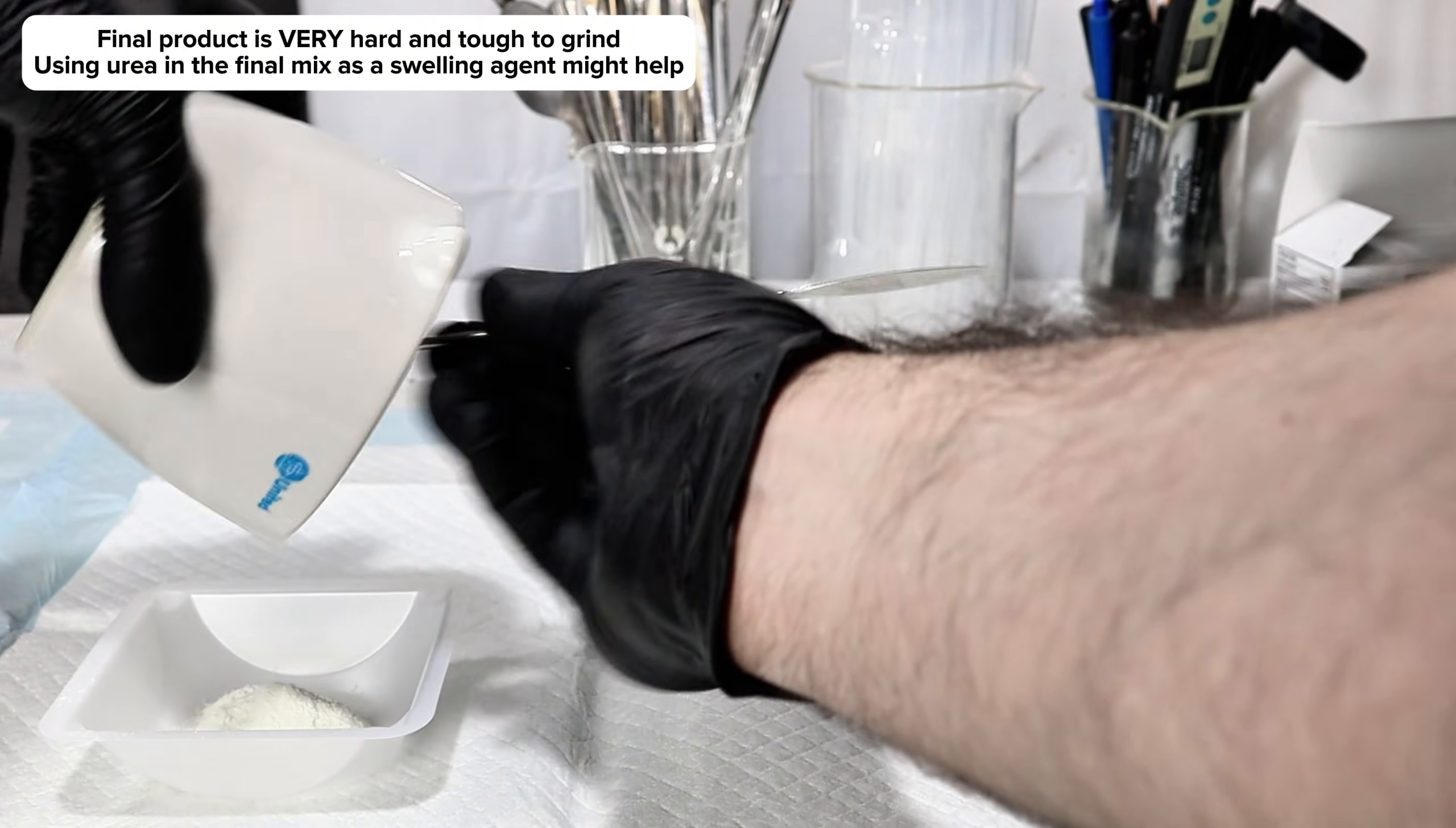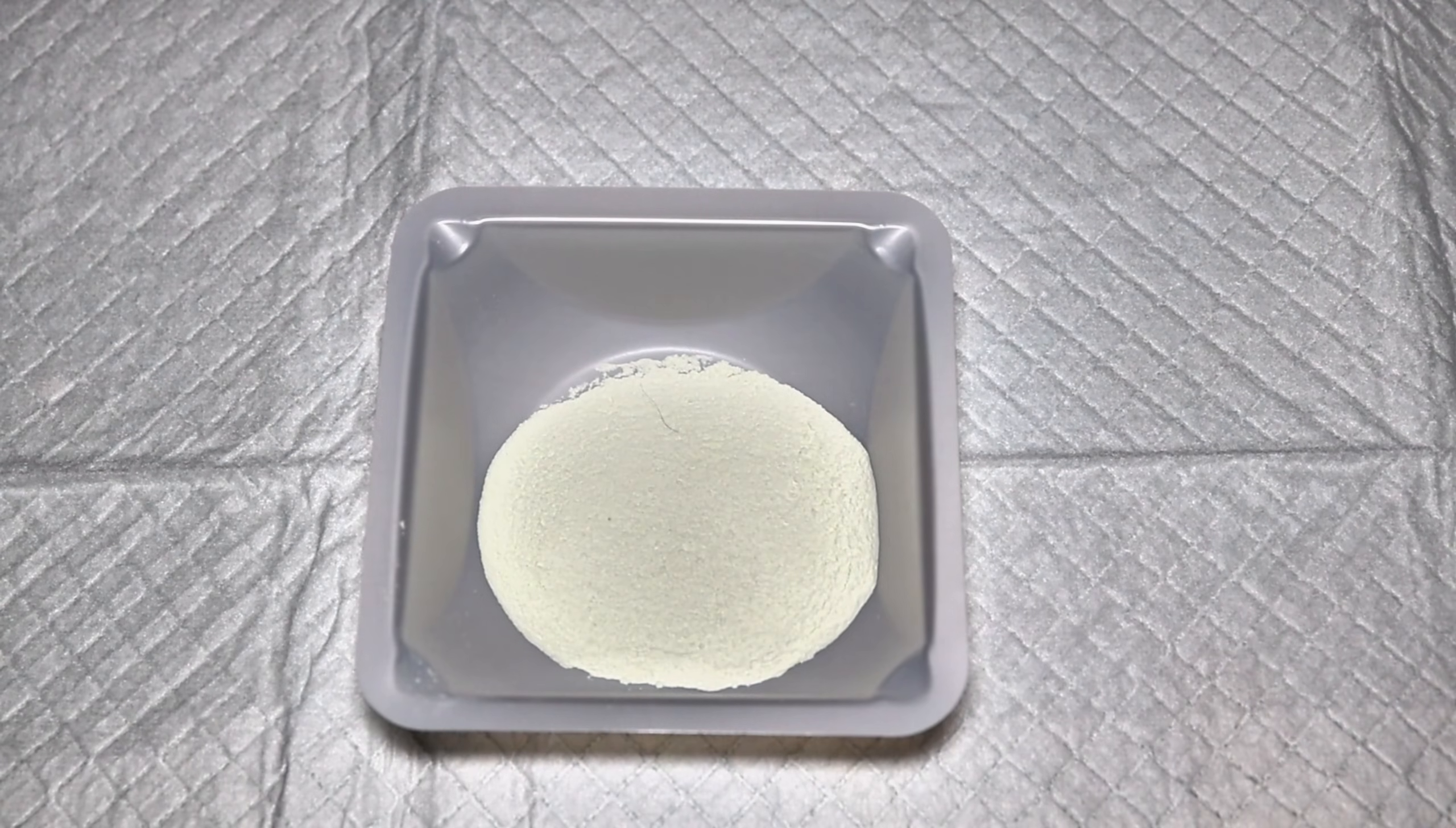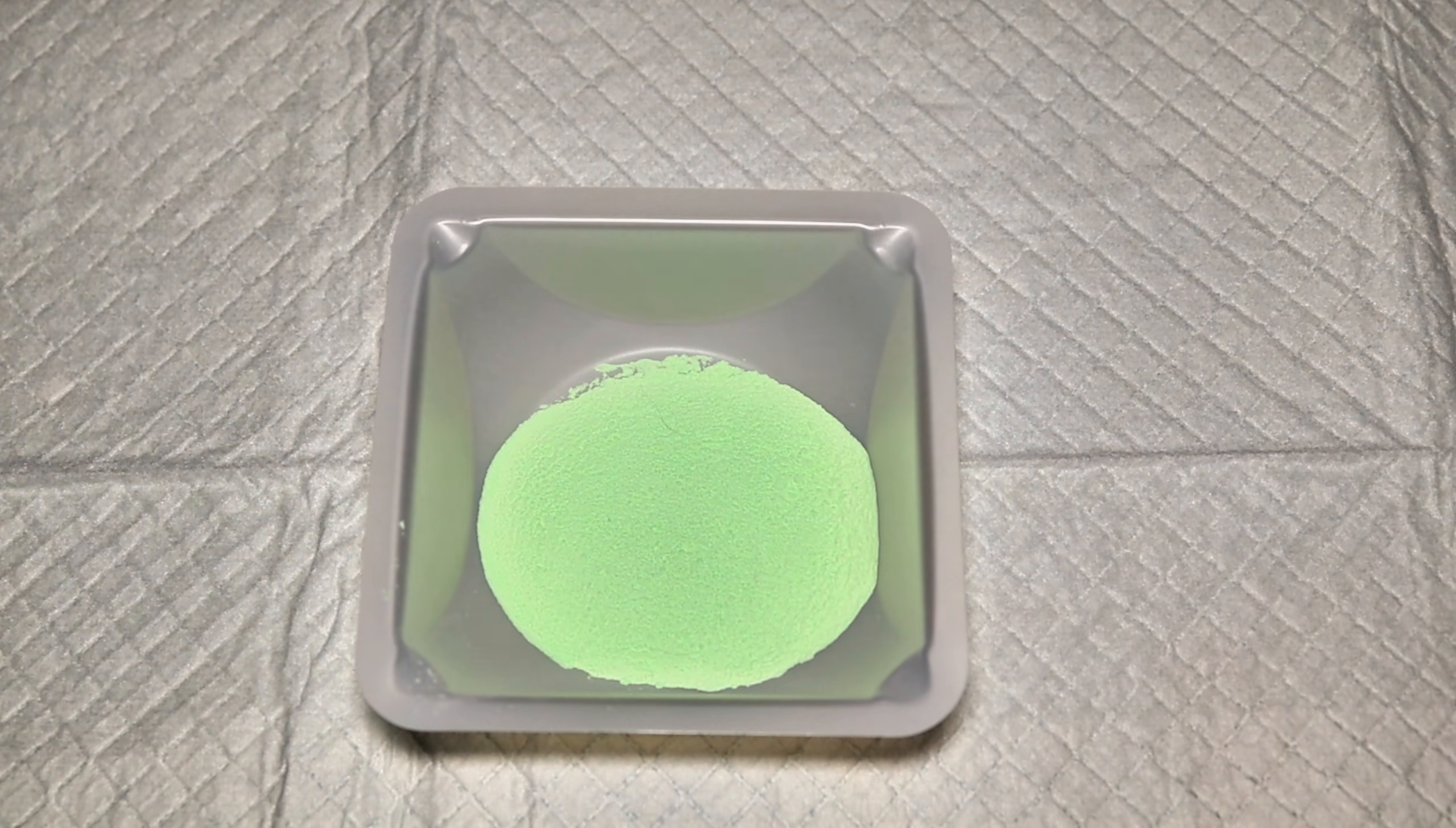Eventually, I did finally powder it down to the point that I felt it was as good as it was going to get, and then I dumped the resulting powder into a weighboat. I went ahead and then cut the lights and was delighted to see my powder glow. To be completely honest, I did check to see if this worked long before I went through the effort of powdering it, which it obviously did.